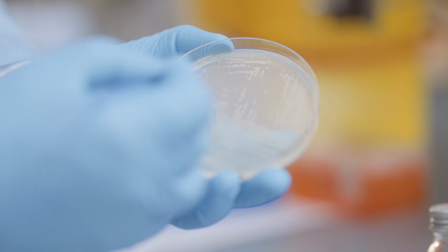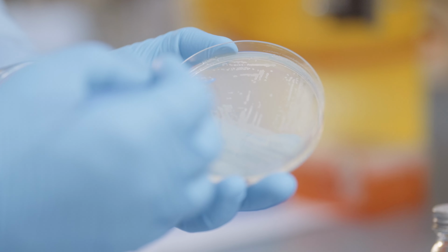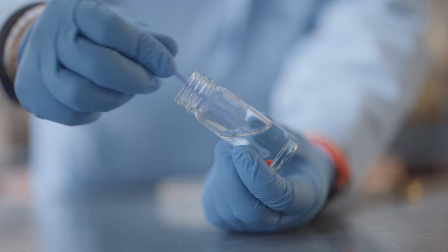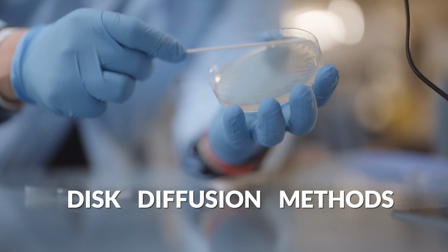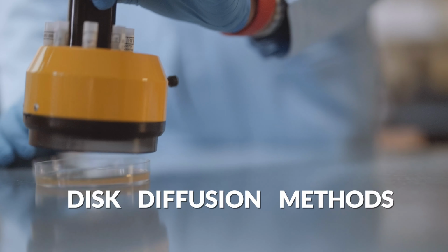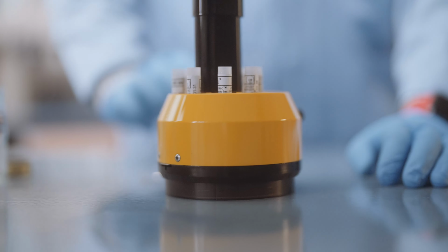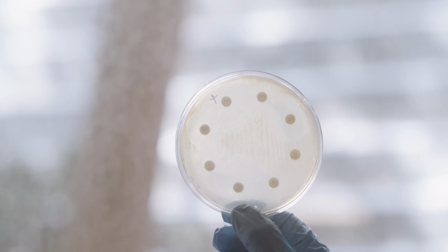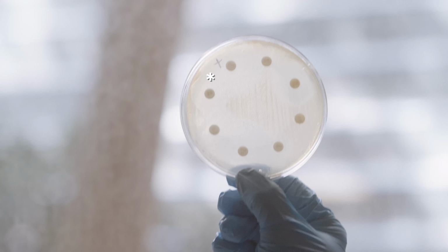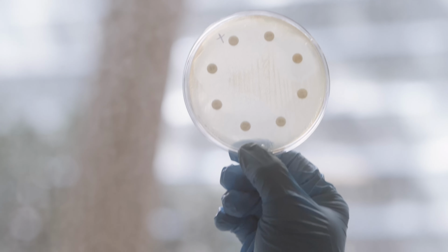So let's imagine that we have isolated a new bacteria and want to test to see which antibiotics will work against it. We've talked about this before on the channel, disc diffusion methods, where we spread the microbe across the entire surface of the plate, add a series of antibiotic discs, incubate the plates, then measure the zone of inhibition around each disc. The bigger the zone, the better the antibiotic works in killing the bacteria. If this zone is smaller than a standardized value determined by diagnostic labs across the world, we consider the bug to be resistant to the antibiotic.